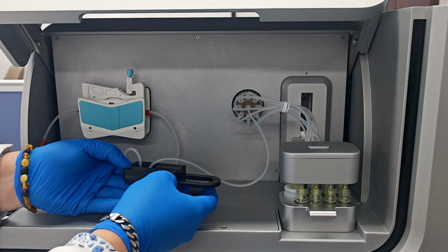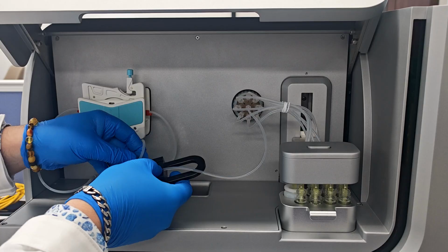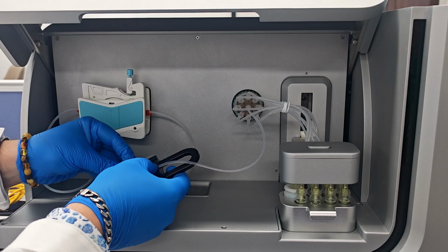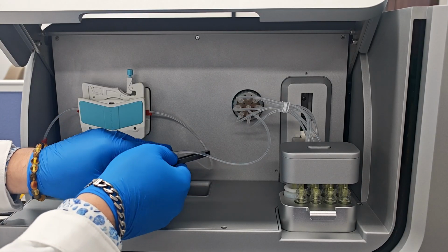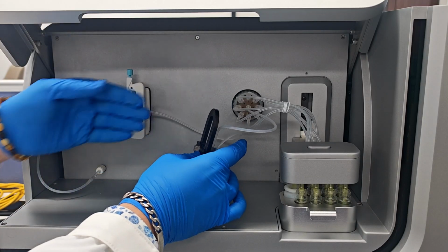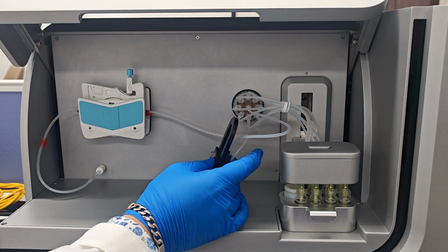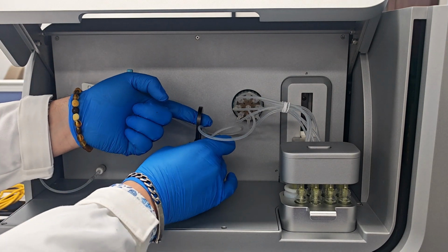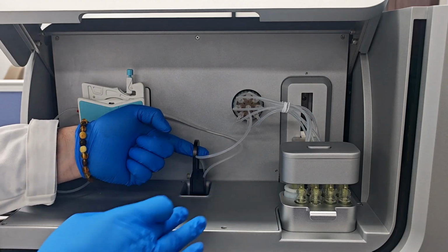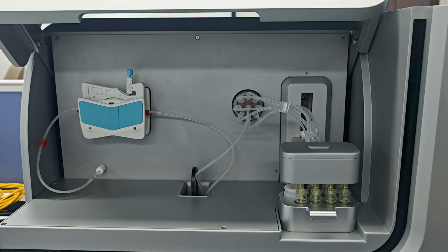Now we see the back of our holder. We put the tubes on the trolleys to make sure that they are located correctly, and we put our holder back to the system when this screw is located towards left side, simply by one finger we can put it down to the system.